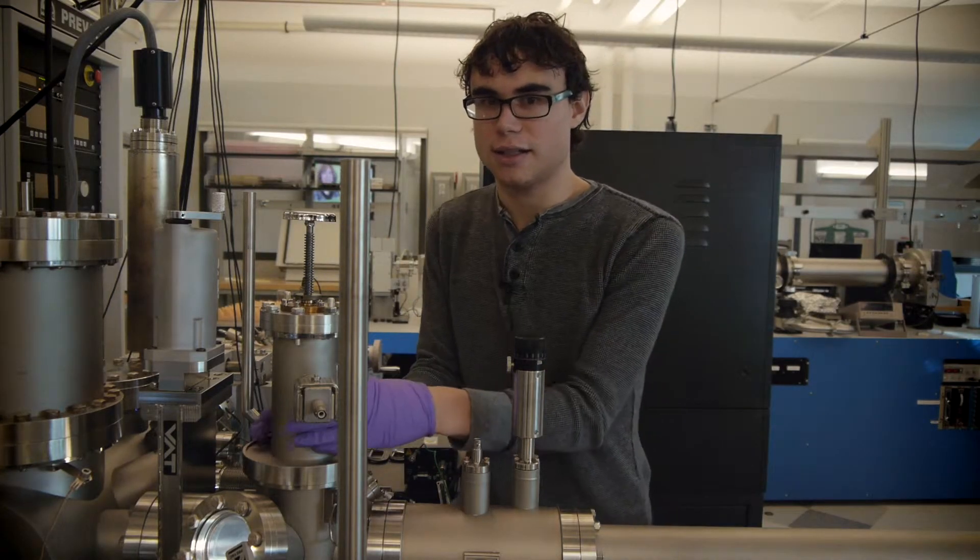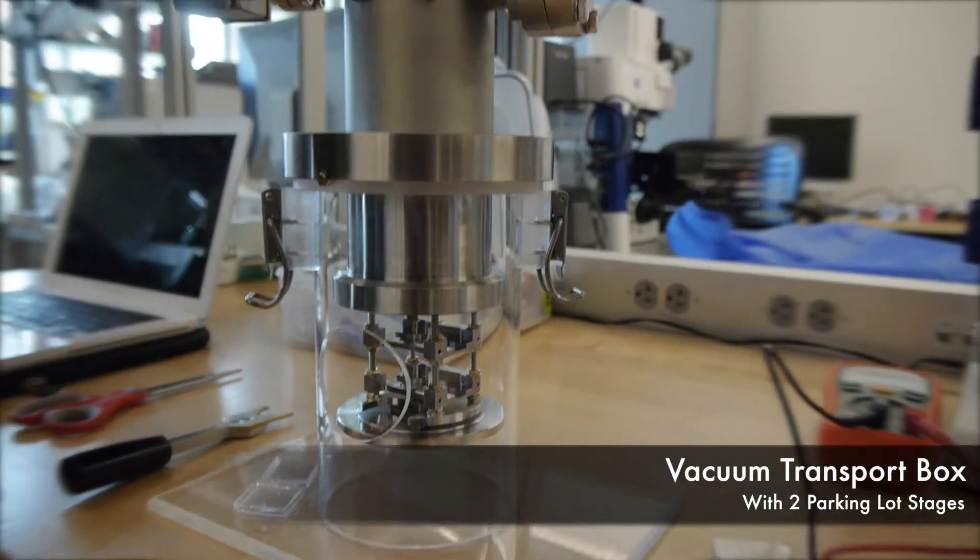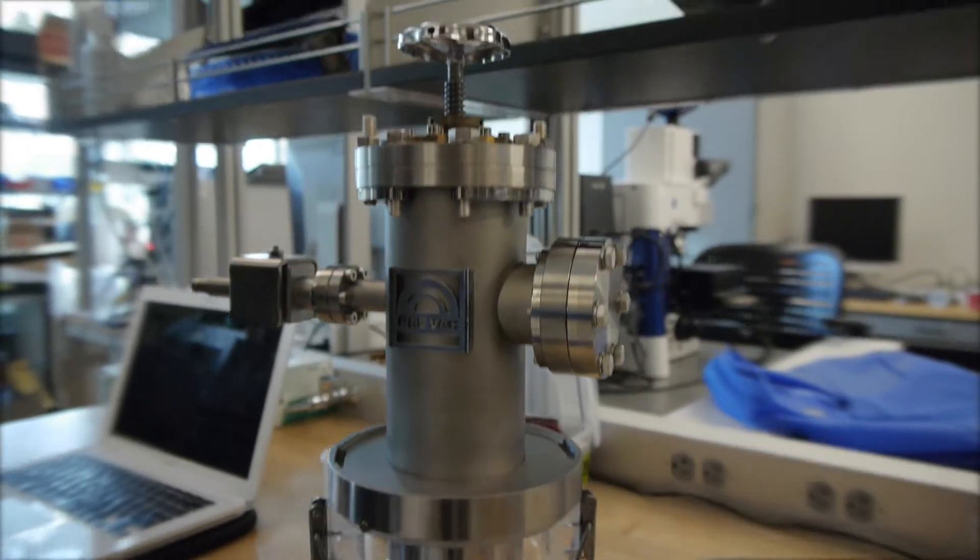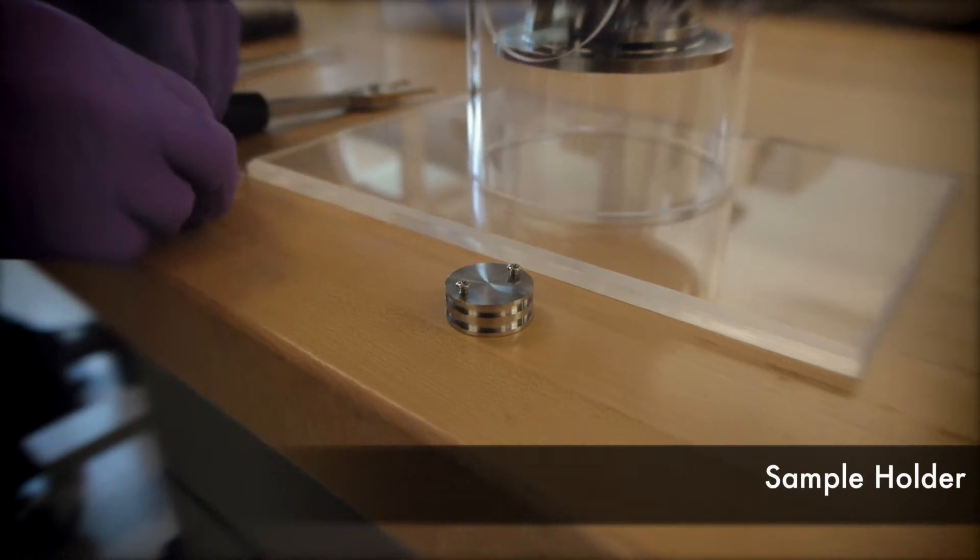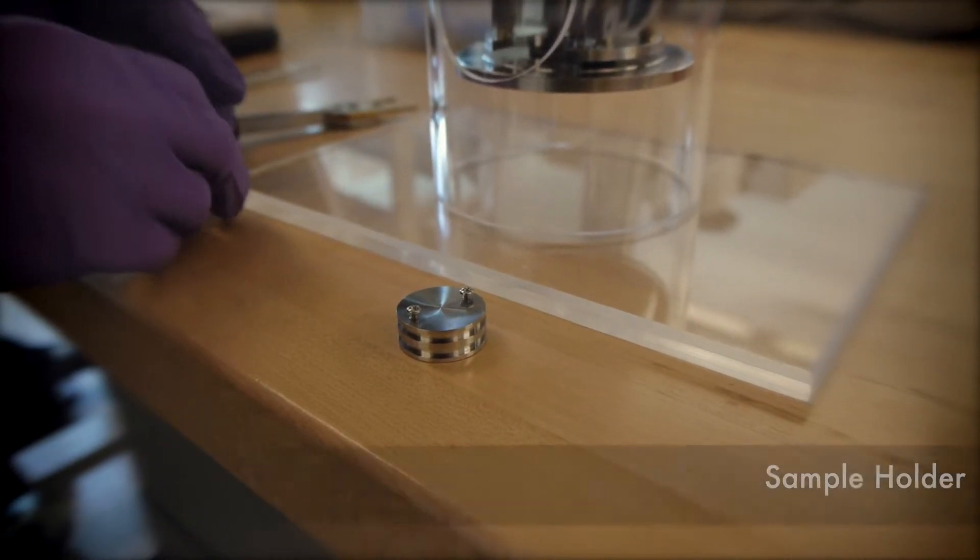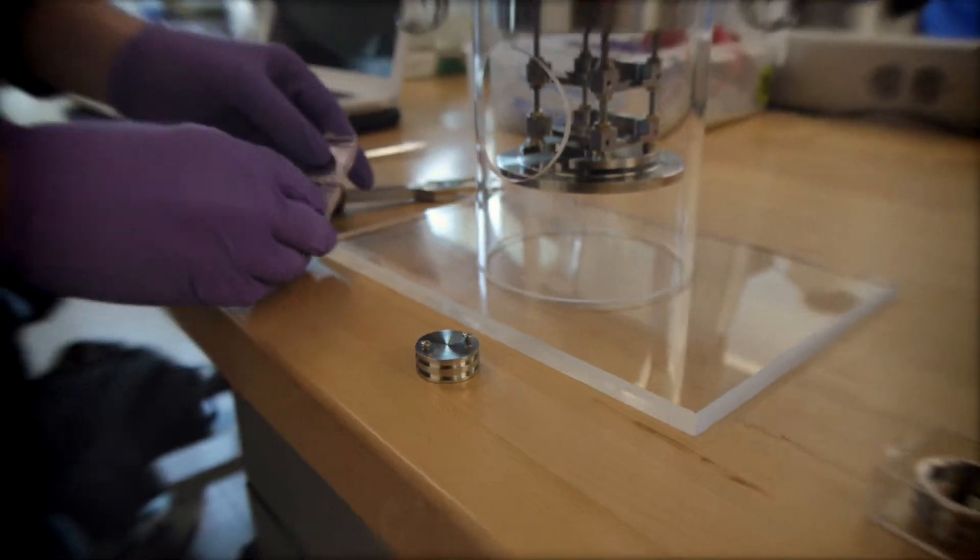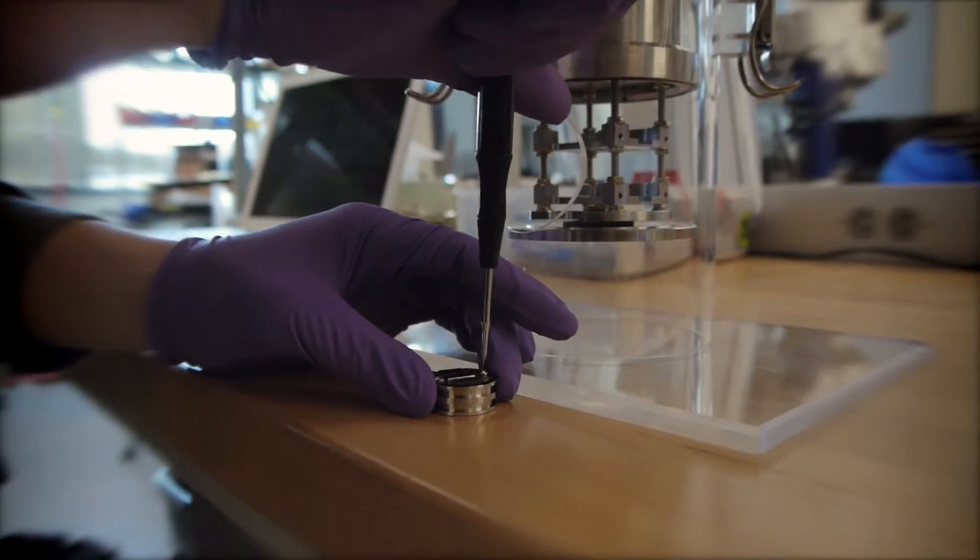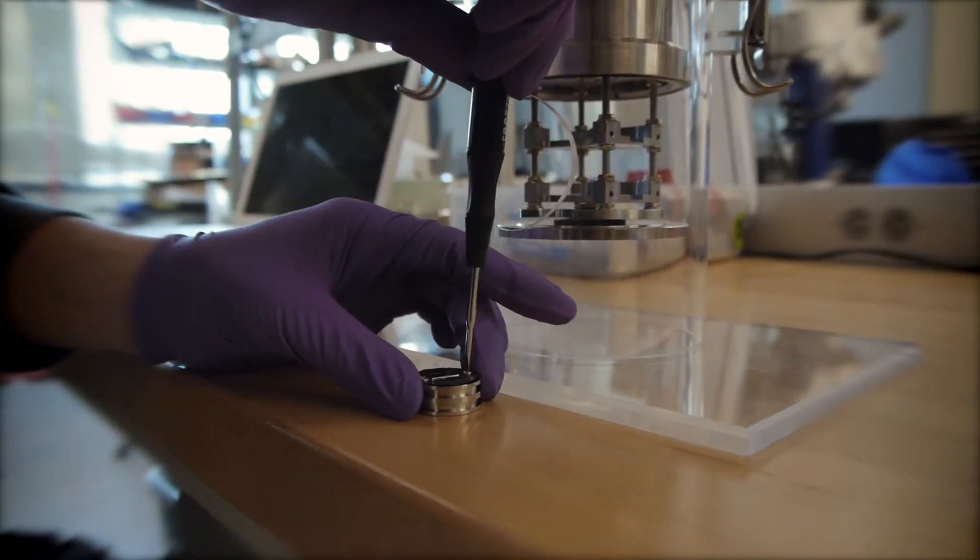So, let's go. Here's the puck where the sample is loaded. Right now I'm attaching the sample to this puck.